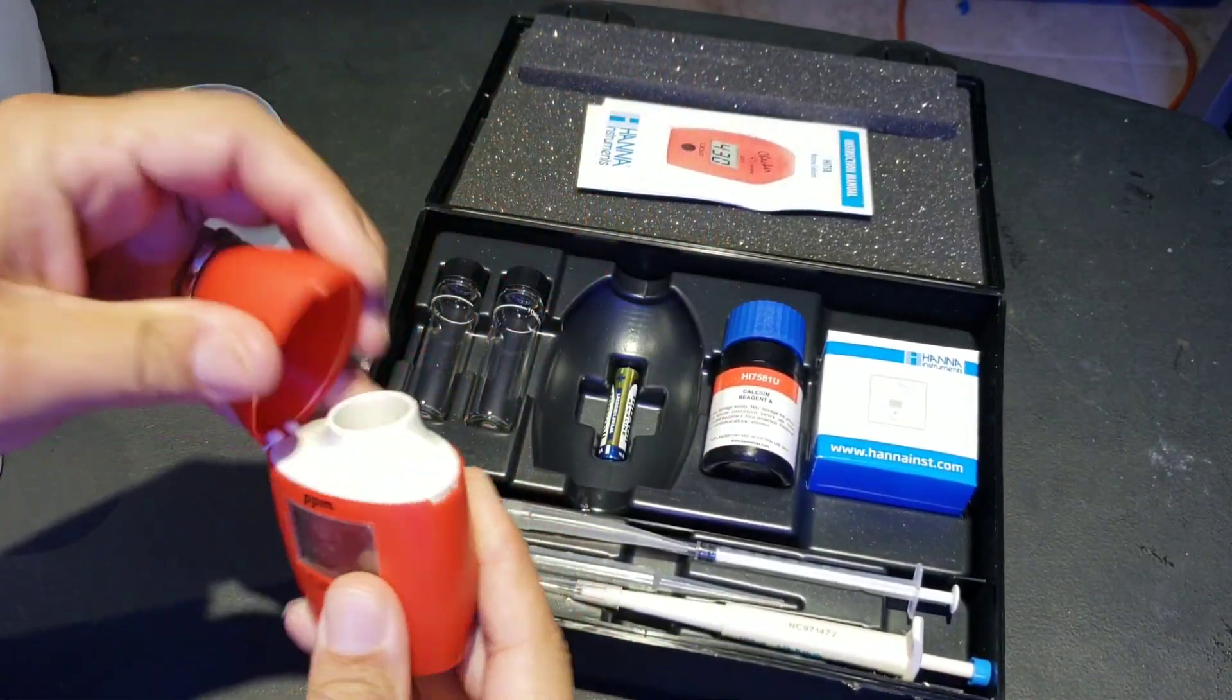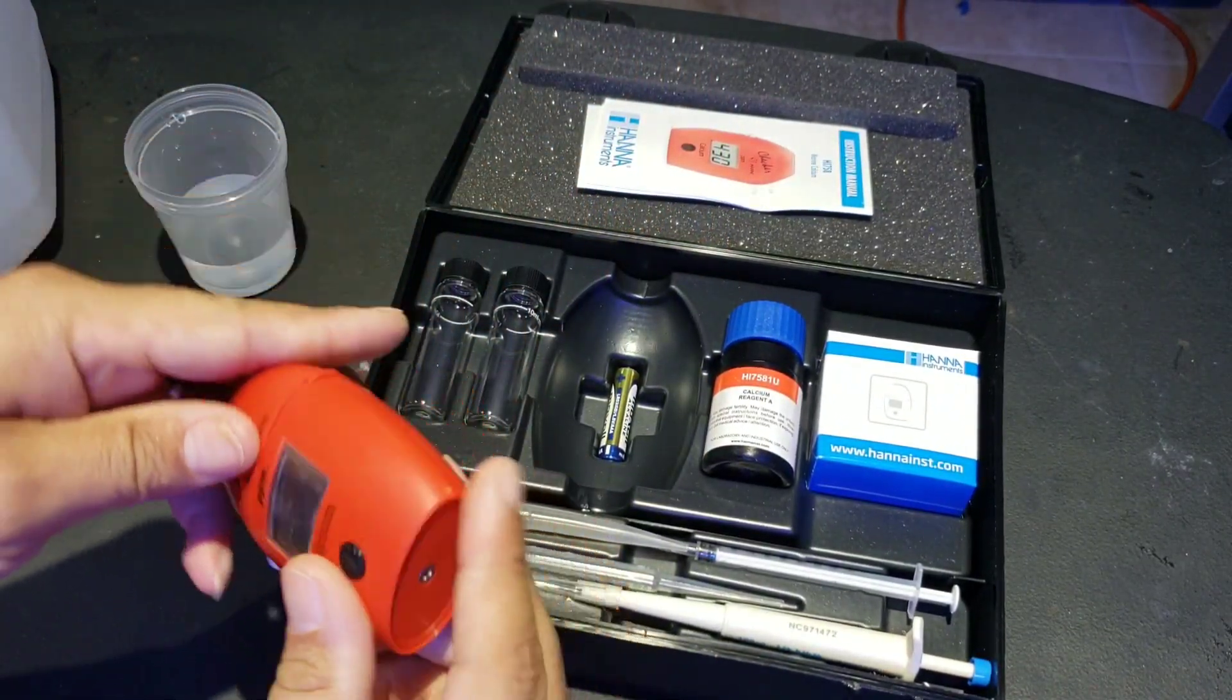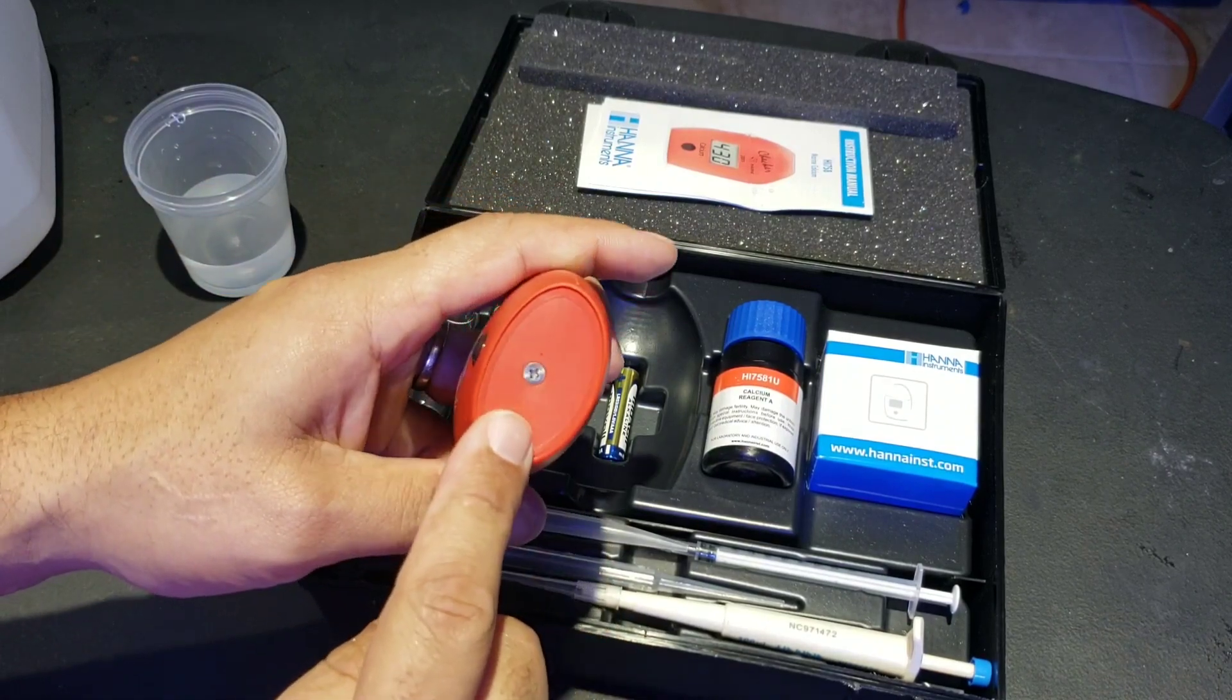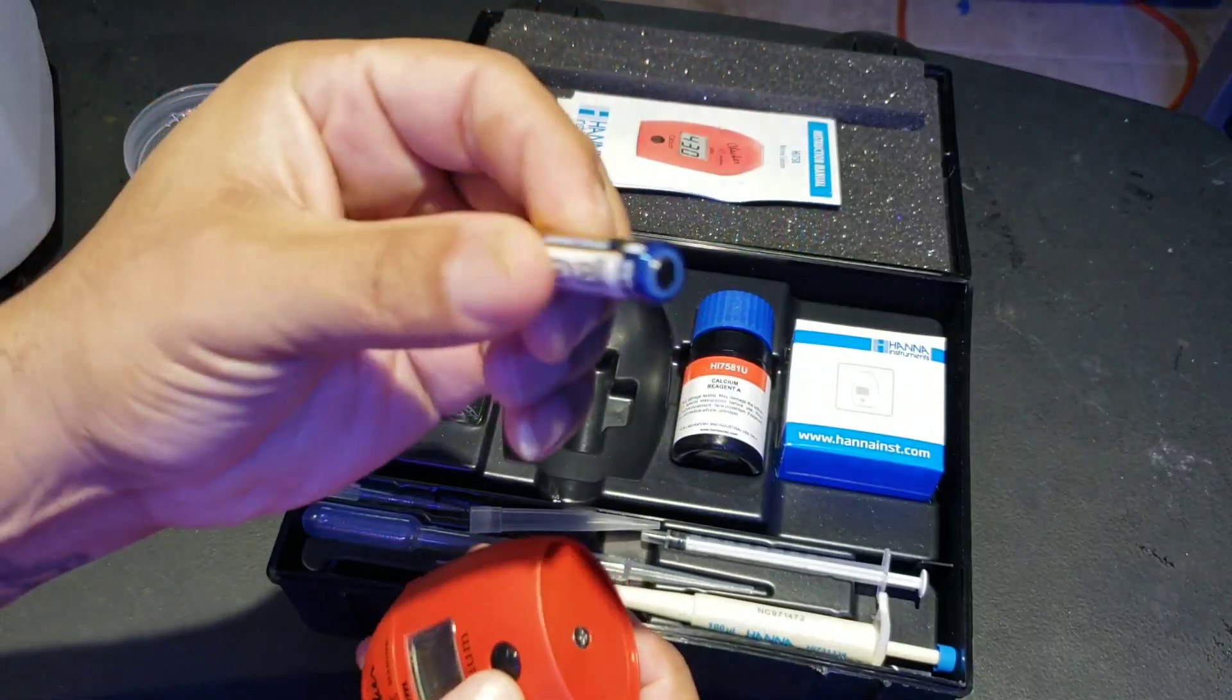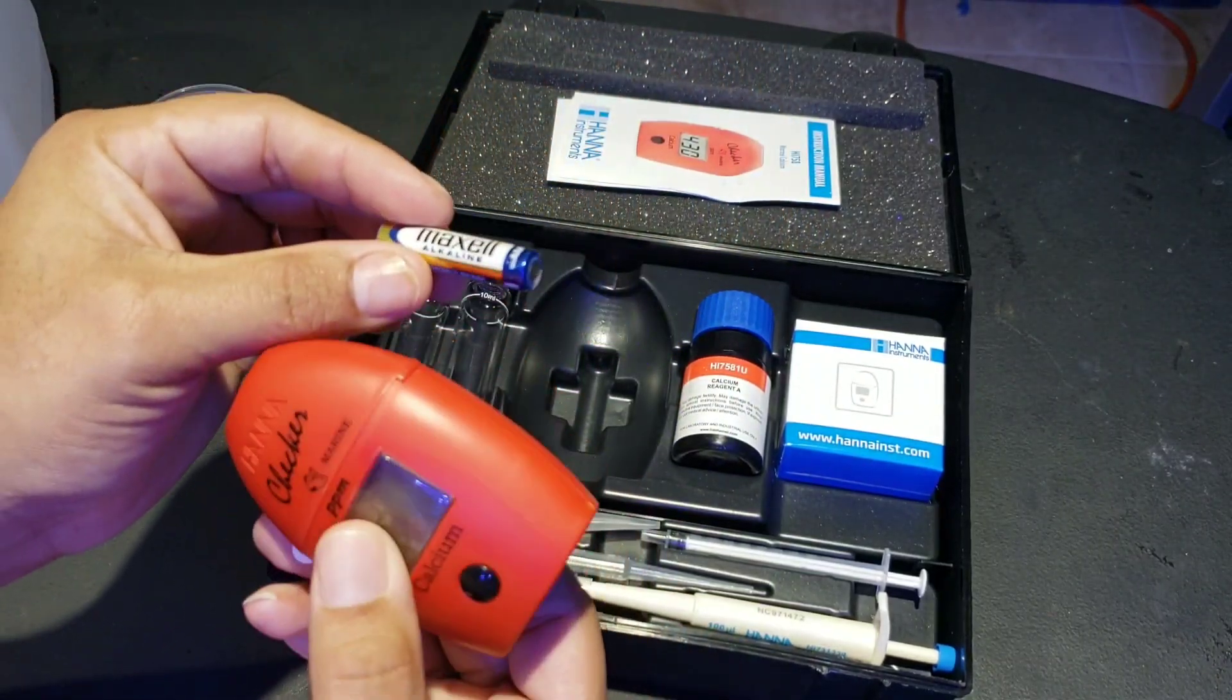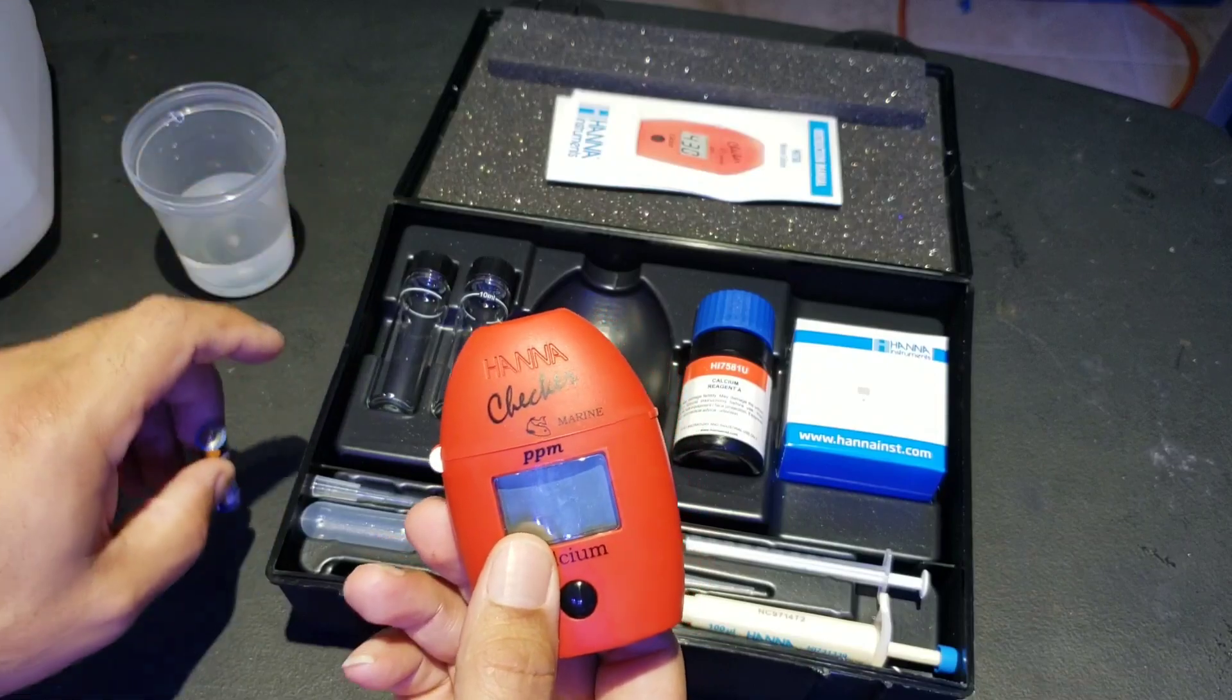Let's get this out. Now, we do have to open this up. It comes with the battery. So I'll open this up, install the battery and we'll be right back.